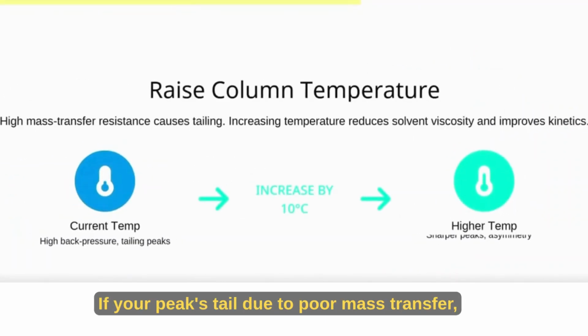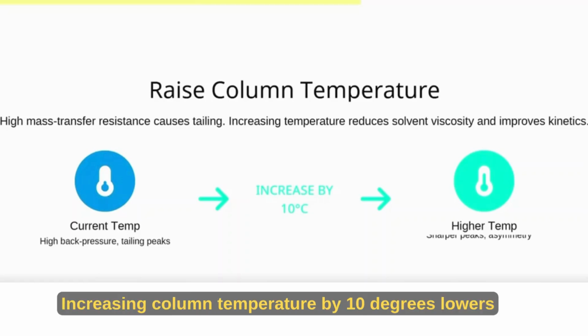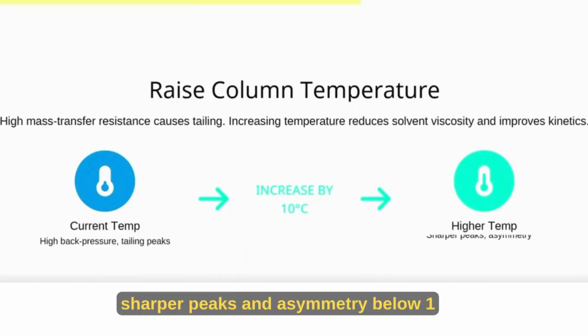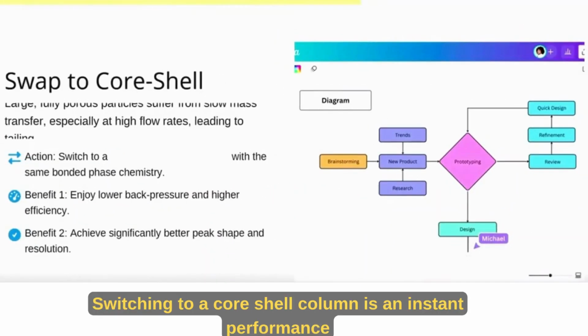Raise column temperature. If your peaks tail due to poor mass transfer, temperature can help. Increasing column temperature by 10 degrees lowers viscosity and improves efficiency. The result: sharper peaks and asymmetry below 1.2.